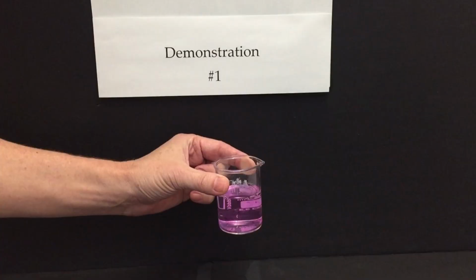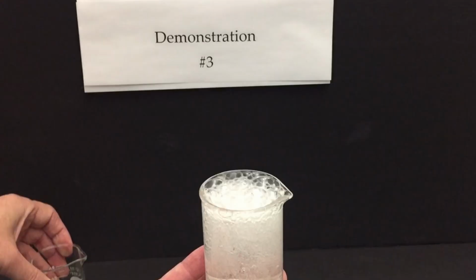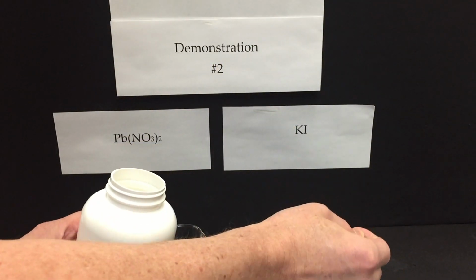It's a series of 3 different demonstrations that I use to train my Chemistry 11 students how to observe. The intended audience is the beginning chemistry teacher who wants some very easy demonstrations to do in the lab. In the video, first I show some demonstrations that you can give to your students if you don't have access to the chemicals yourself, followed by some questions you can ask them to help direct their thinking to become better observers. And the last half of the video, I show you how to set up the actual demonstrations. I hope you enjoy.